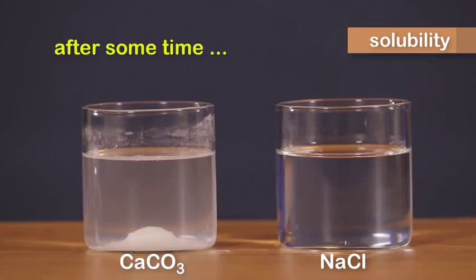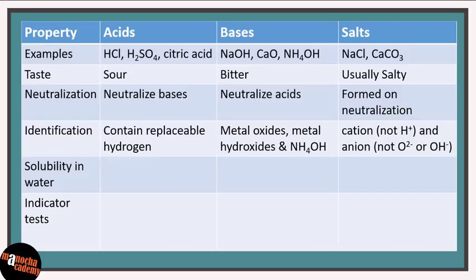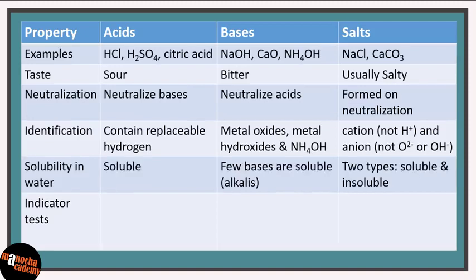Can you see that even after some time, all the sodium chloride is dissolved in water and the solution is clear? But if you look at the glass of powdered calcium carbonate or powdered chalk, can you see that heap of powdered chalk at the bottom? That's because it's insoluble in water. Let's place the solubility details for acids, bases, and salts on our concept board.